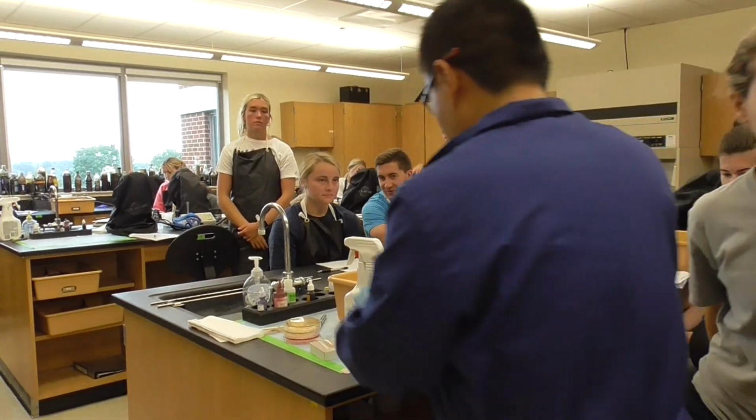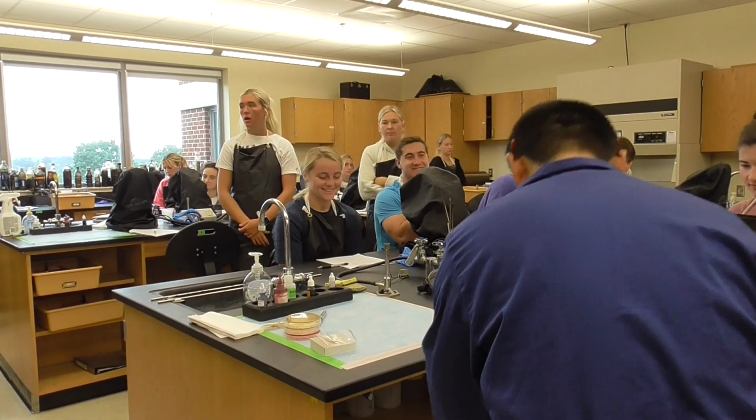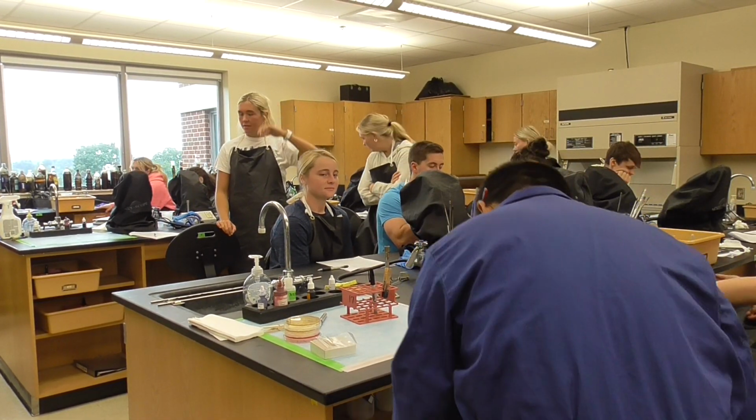So just borrow your stuff a little bit. These don't move down. And we'll do the rack here.